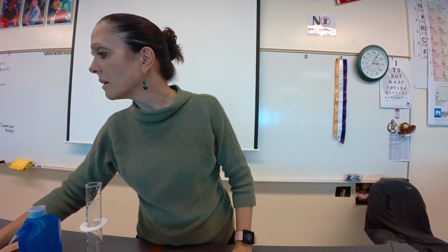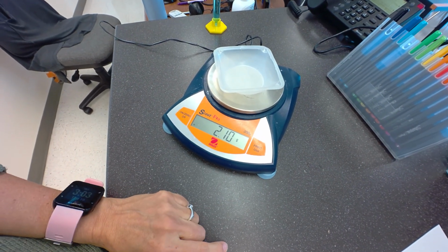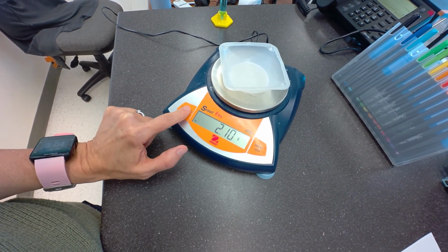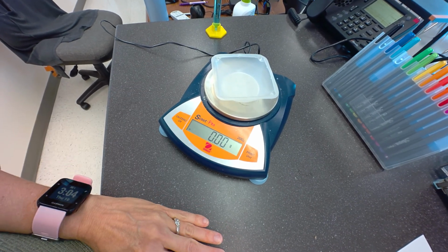The last thing we need to do is get the density of some shot. In order to get the density of the shot, we're going to have to use what is called a weigh boat. When we use a weigh boat, we're going to put that weigh boat on the balance, but you'll notice that the balance no longer is reading 0. And that's a problem. We don't want to weigh this weigh boat. We just want to weigh the shot. So you'll see that we have this on and 0 button. So we're going to 0 this. Sometimes it's also called a tare button. Now it's reading 0, even though we have this weigh boat on the balance.